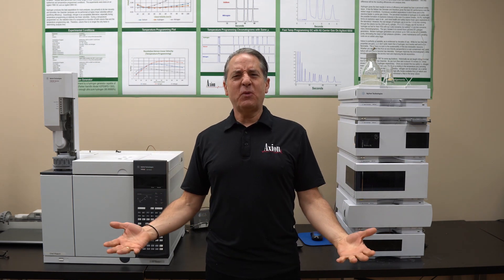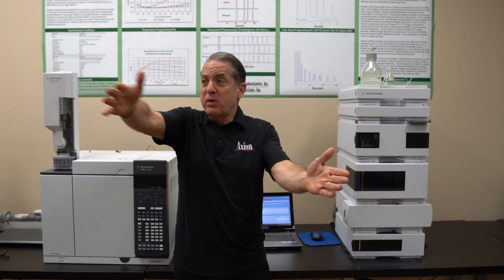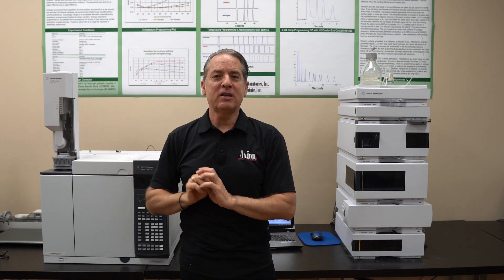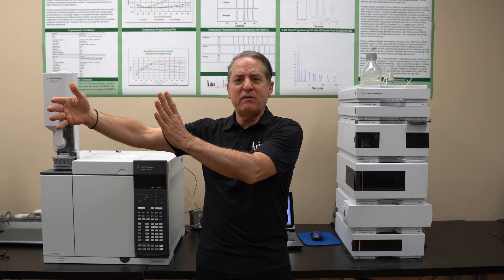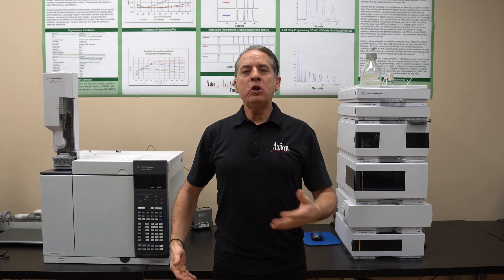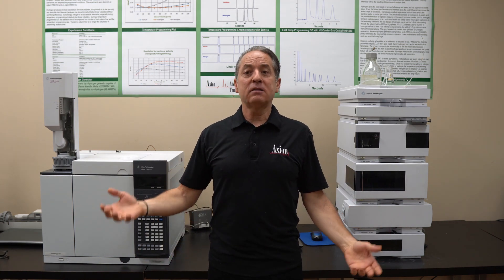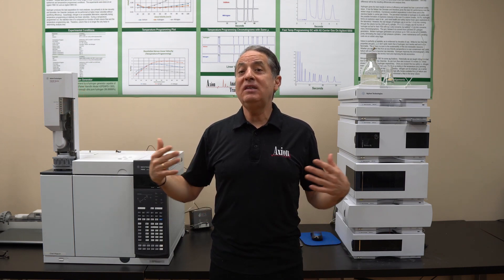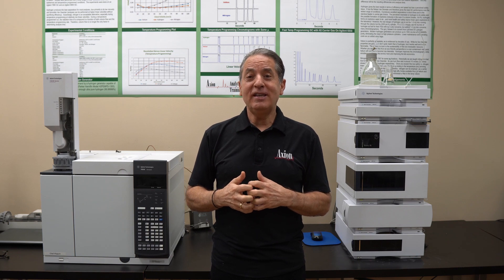We're going to do a scan from 40 all the way up to 325 and simply see where the peaks come off. If all the peaks come off between 250 and 325, then there's no need to start at 40 degrees. So: one good temperature program from room temperature to column max, hold that column max for an extra 10 minutes, and simply see where the peaks come off. That is method development in GC. It's a lot easier than it sounds.